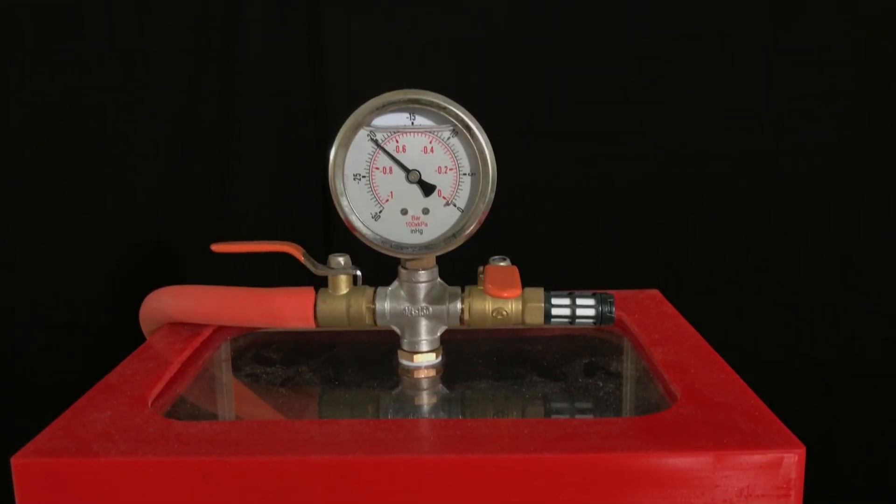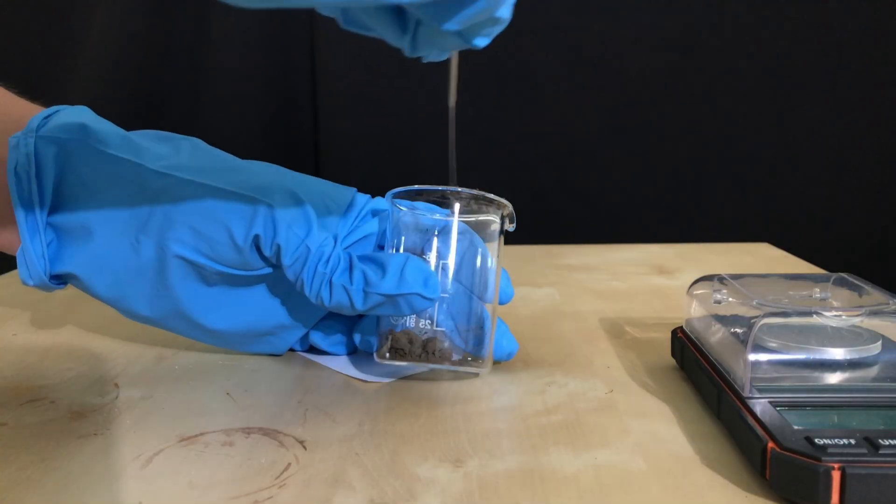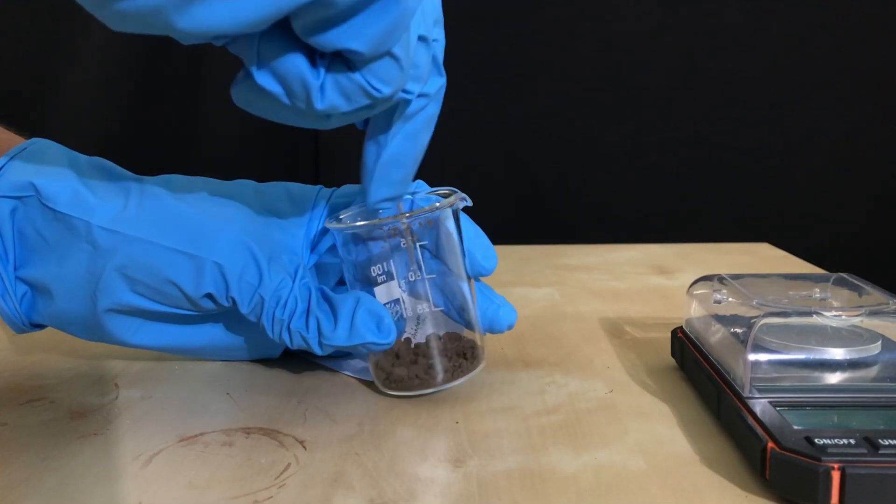Air drying would work just fine, but I'm not a fan of it, therefore we are going to use a vacuum desiccator. Drying took only one day, the next day it was perfectly dry, and now it's time to transfer to a suitable storage container.